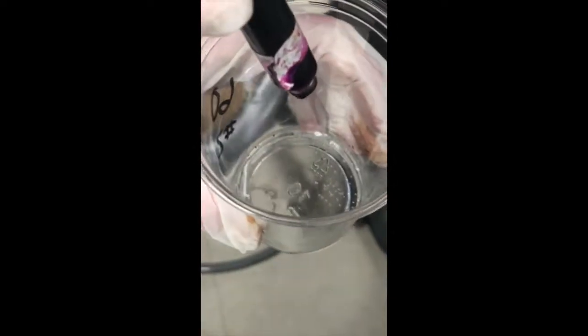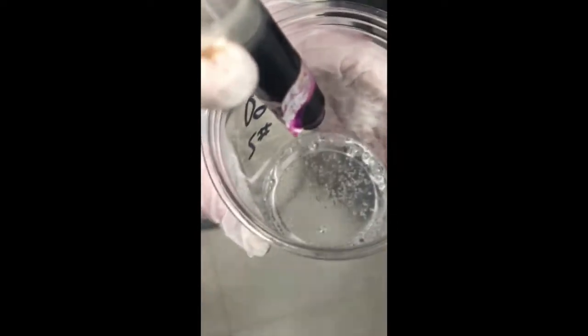A baseline that tells us how much H2O2 was in the original sample was provided for us by our teacher. Using this baseline and subtracting the amount of KMnO4 added to each solution, we would be able to calculate how much H2O2 was catalyzed during each time interval. In order to determine how much KMnO4 we added to each 5 milliliter sample, we counted the number of drops that it took for the titration to be completed.